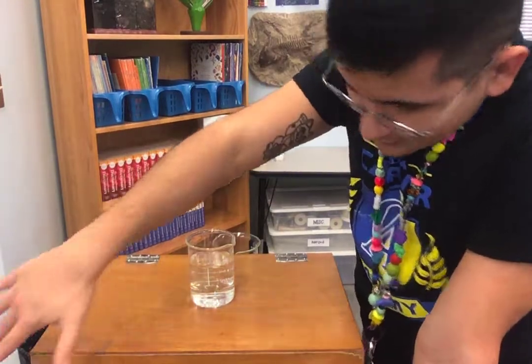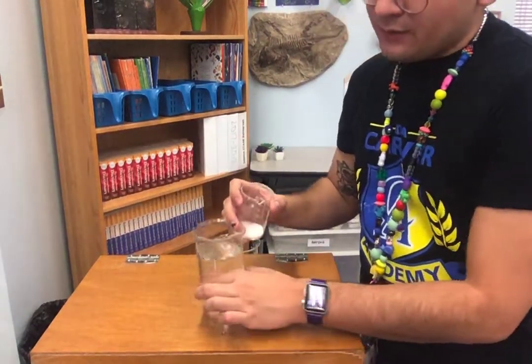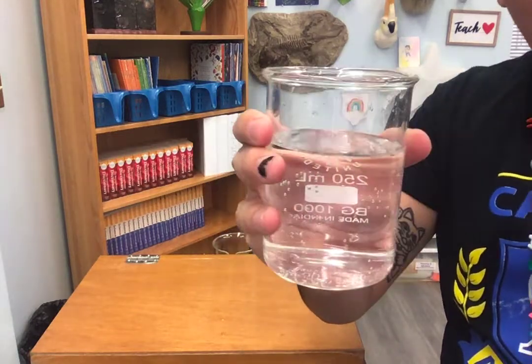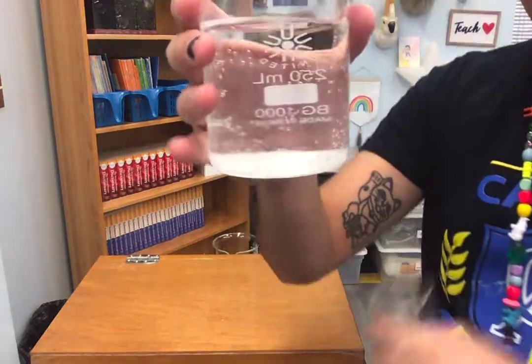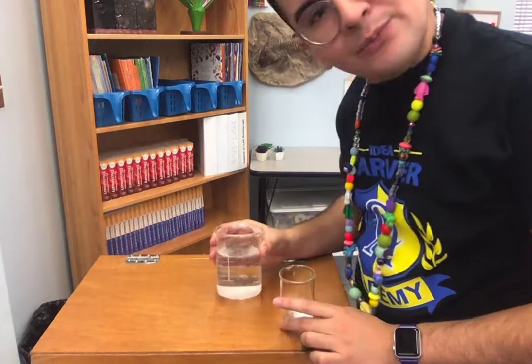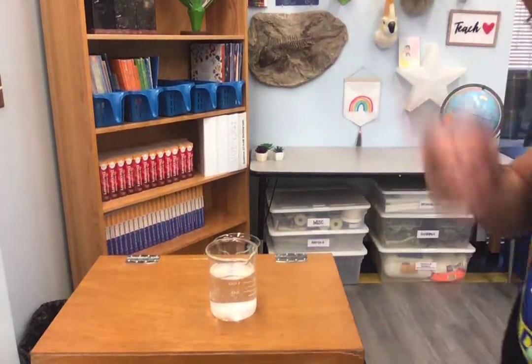All right. Let's test our next substance, which is salt. Now, I'm going to have to get a little closer because if you remember from our last video, salt is soluble. So if I don't show you quick enough, it'll dissolve before you can see. So watch what happens when I pour the salt in. Watch where it goes. Does it float or does it sink? Ready? 1, 2, 3. Where did it go? Straight to the bottom, right? So the salt went down. So is it more dense or is it less dense? I'm observing that it's sinking.